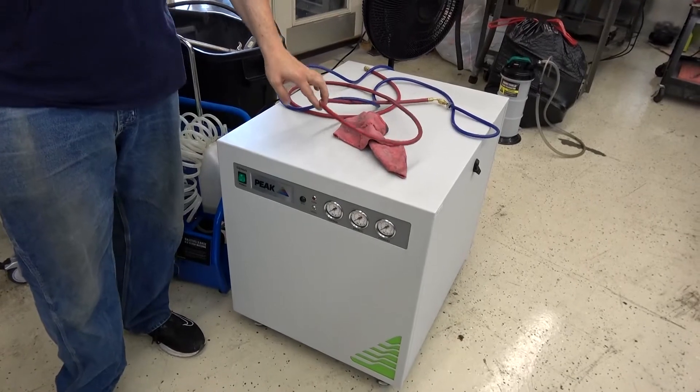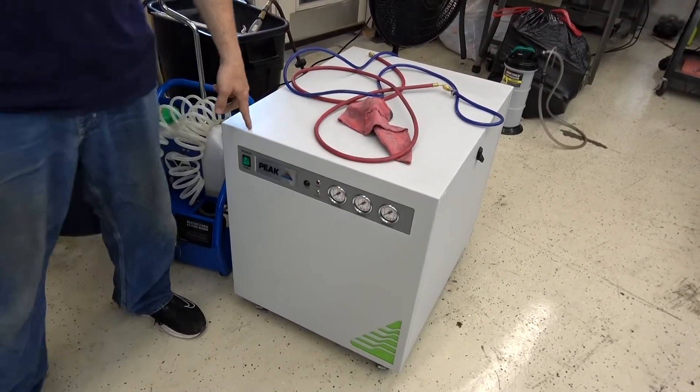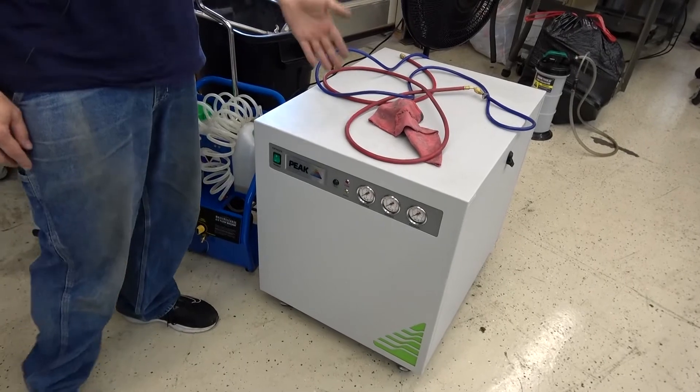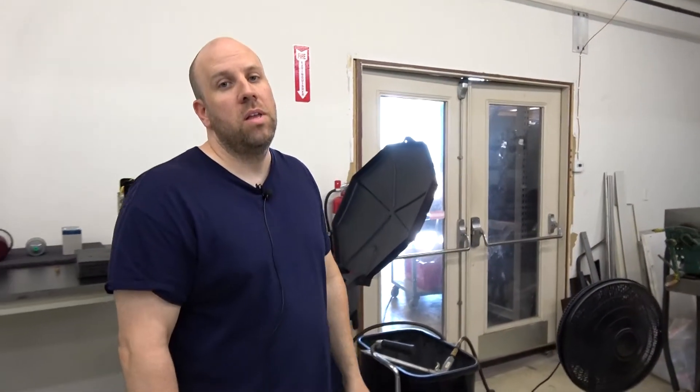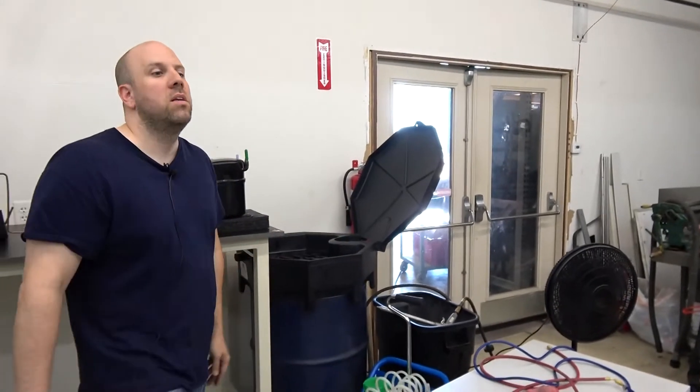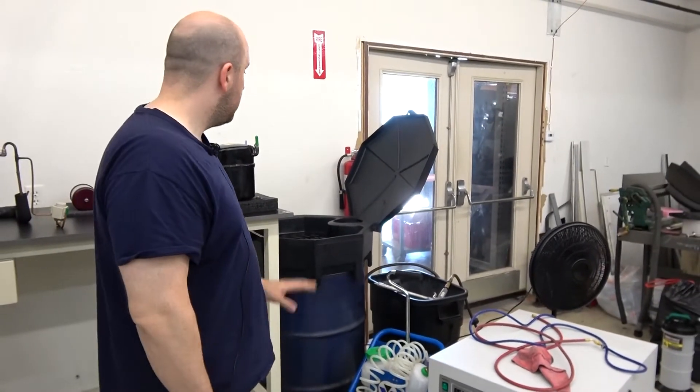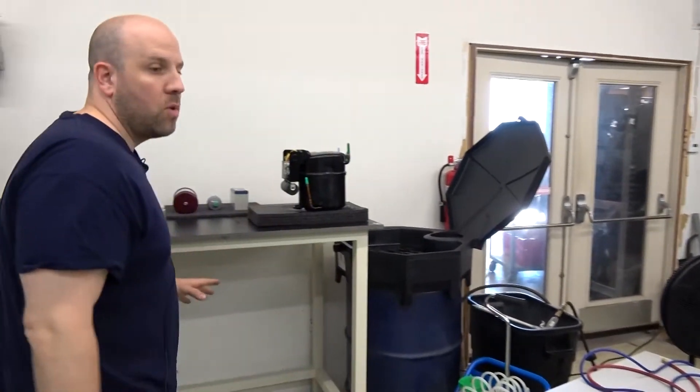So we purge all the lines and components with our nitrogen generator and we let that thing run for sometimes hours to make sure we get all the alcohol dried out, purged out of there. Then, so after that's all done, we clean up.